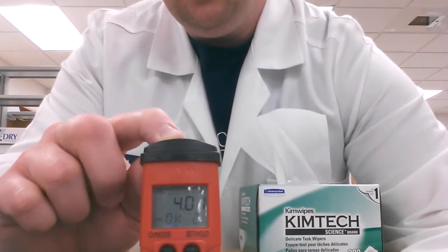This may take 30 to 45 seconds. Alright, it says okay. Now it's ready to use.